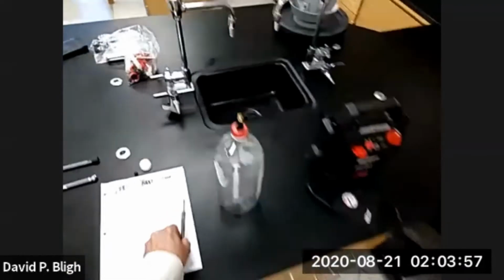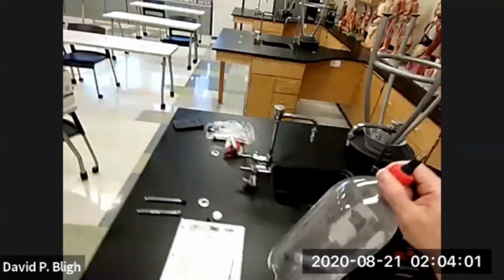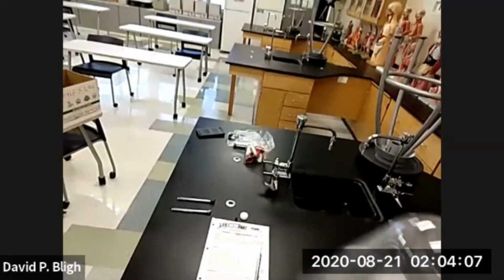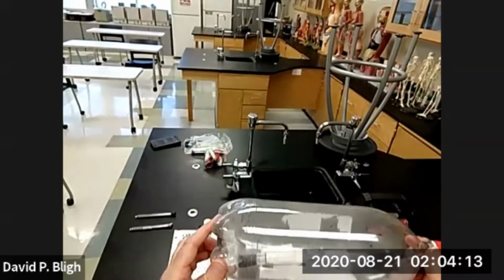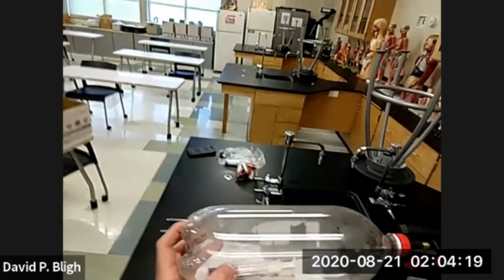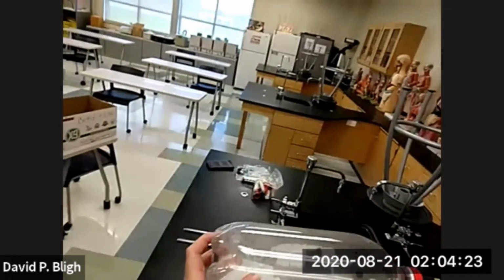Now we're going to check the volume. I always swirl it around because sometimes that gasket, that seal, sticks. So we want to encourage it to release. Then we rotate it around to where we can see the dial. Now what you need to do is check your measurement on the same side of that black ring as possible.